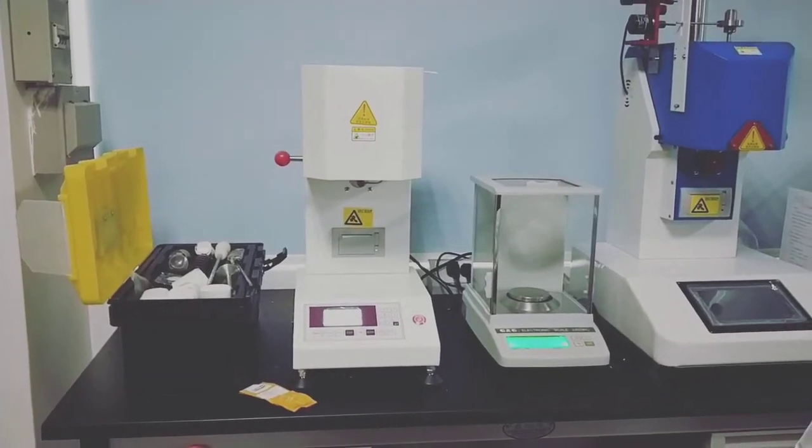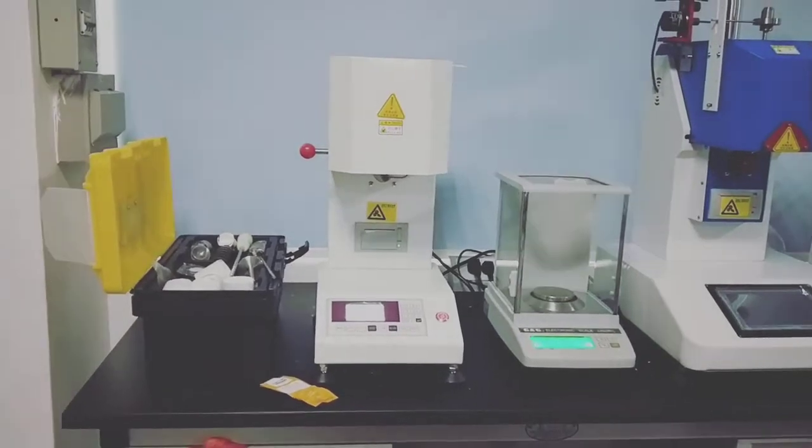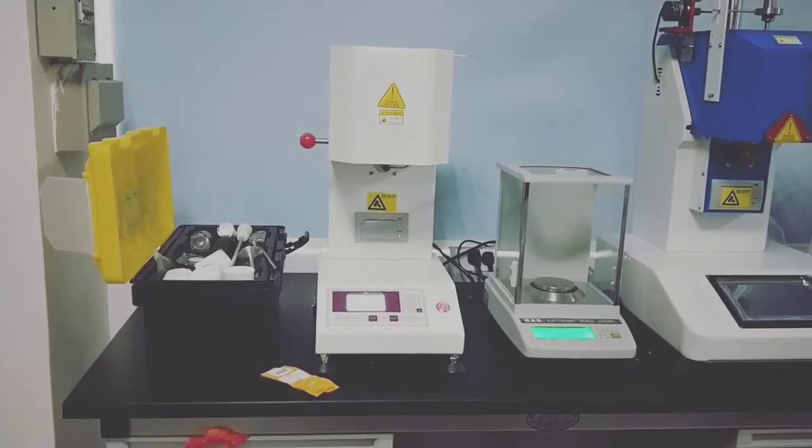Thank you for choosing LiYi Melt Flow Index Tester. Today we will introduce the operation of the machine. First, we will introduce the machine structure and its components.